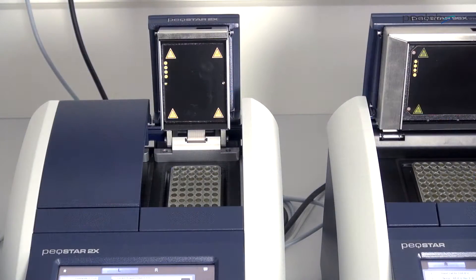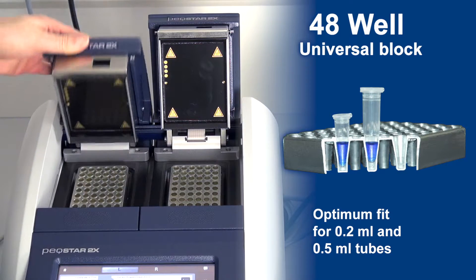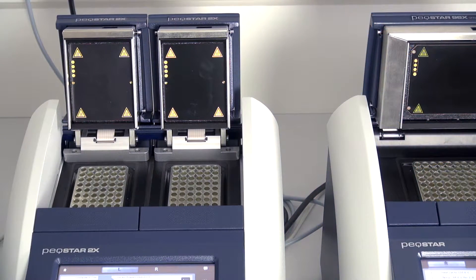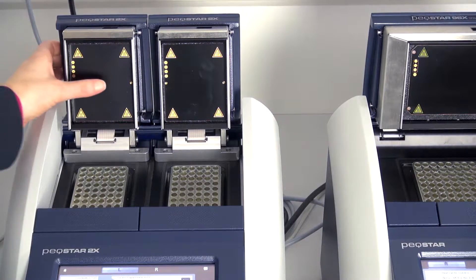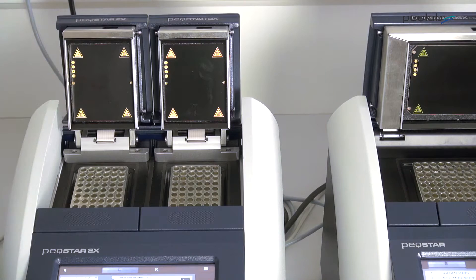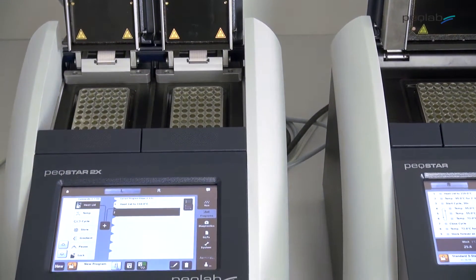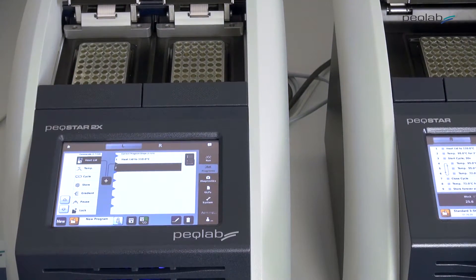It has two 48-well universal blocks which can accommodate both 0.2 and 0.5 milliliter tubes. The heated lid is spring-mounted, automatically adjusting to the height of the tubes. Systems with 96-well or 384-well blocks are optionally equipped with a high-pressure lid.